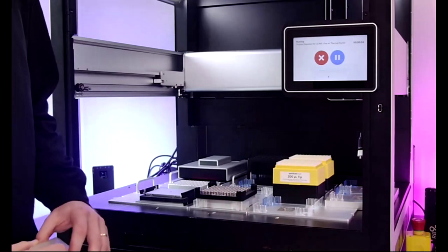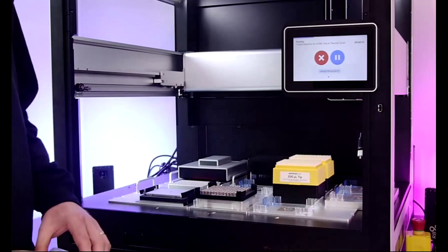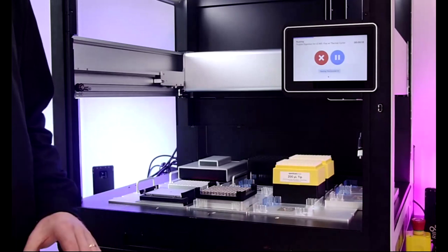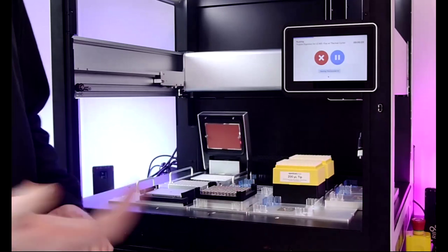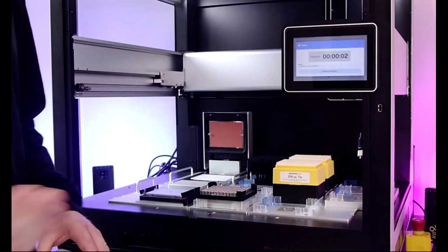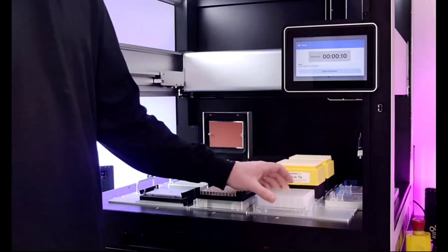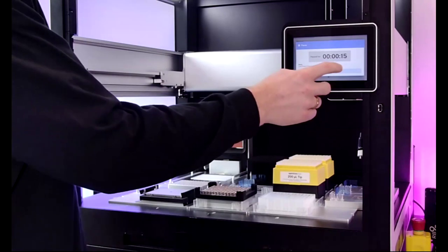The first thing that this is going to ask me to do is open the thermocycler lid first, and then it will ask me to put on a plate, which is going to house our reagents, as these will typically be kept on ice before you want to put them onto the deck. And so this is another great example of how helpful the touchscreen is, so that you can be keeping your reagents somewhere else, refrigerated. You could even not have them prepared until this screen pops up and the protocol will pause for you. And then without interacting with your computer whatsoever, you can confirm and resume.